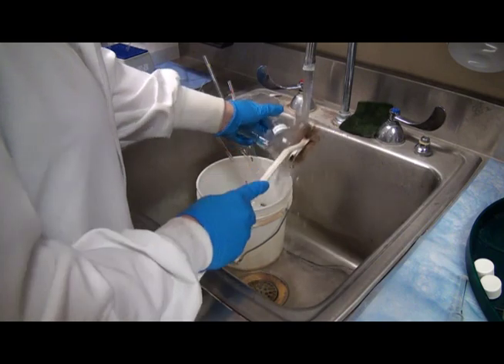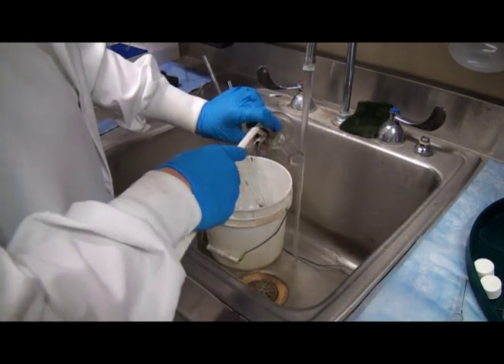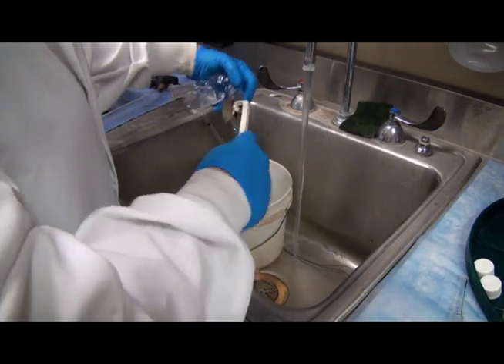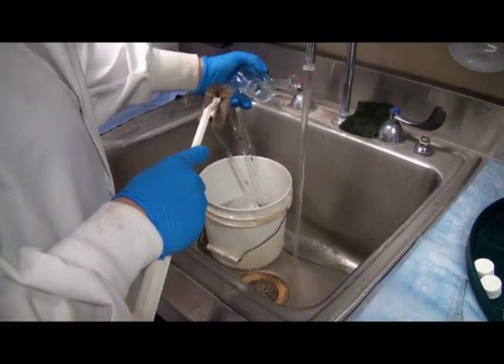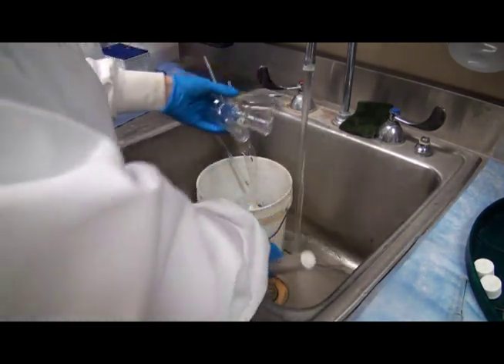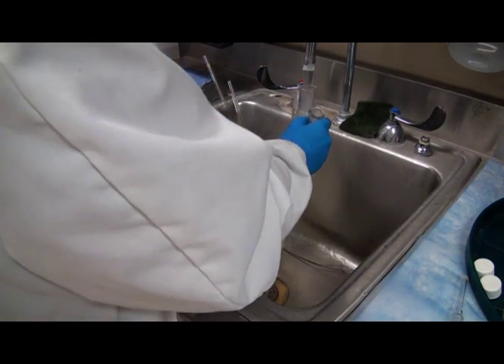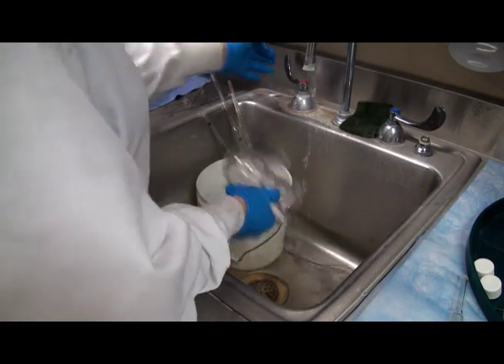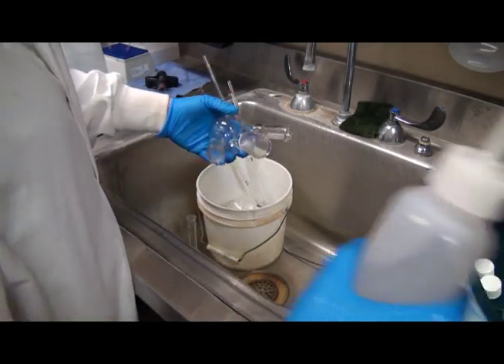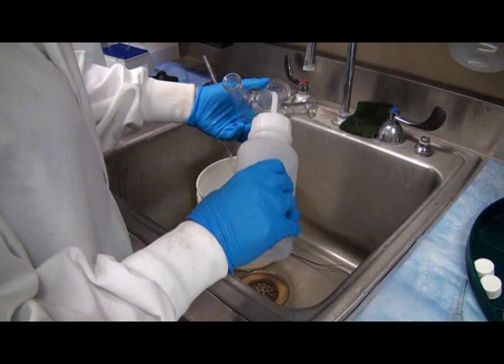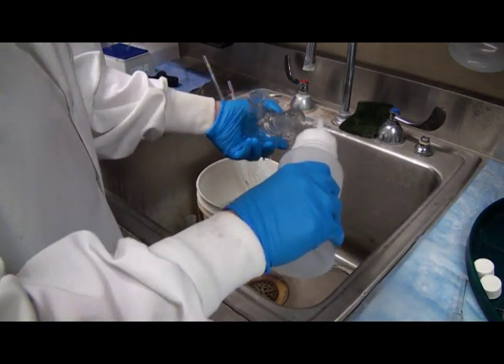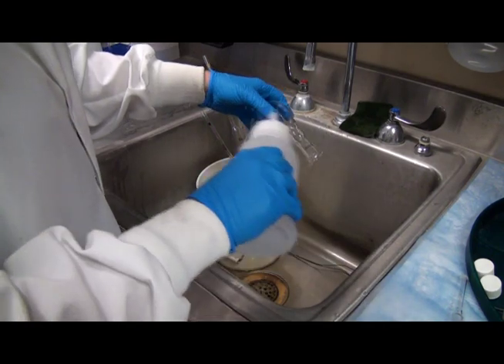After completing the sample analysis, the hydrogen peroxide solution in the impinger tube may be disposed of in the sink. Add 5 mls of color-safe neutralizer to the phosphoric acid sample and take it to greater than pH 3 and dispose with water in the sink. Clean all labware with lab cleaner and rinse with DI water. Dispose of all juice samples to prevent insect infiltration into the winery and lab.